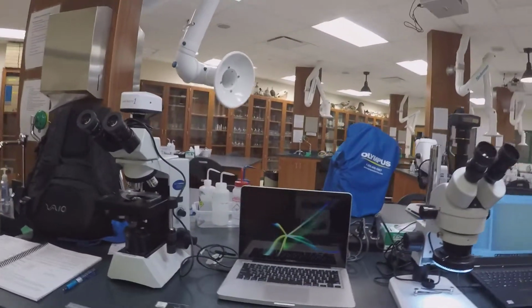Okay, so you can get to see different sides of the organism, or you can dissect it, or whatever you want. All right, so now I'm going to go through lab 6, and I'm going to go through the different procedures. So we skipped procedure number 1, sort of, which is just identifying the parts of the microscope. I'll let you guys do that because it's fairly simple. You can do that on your own.